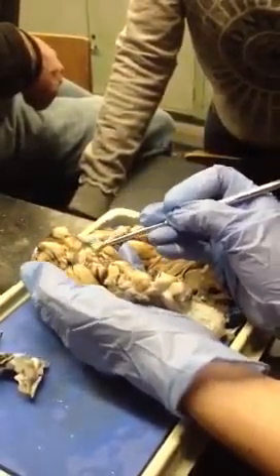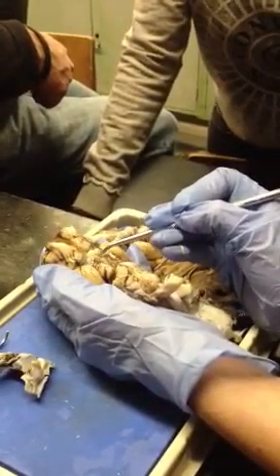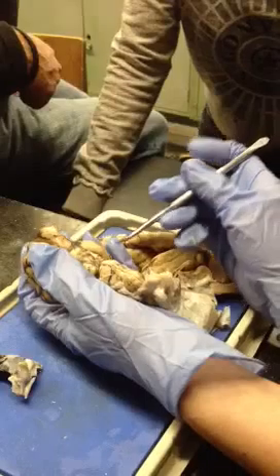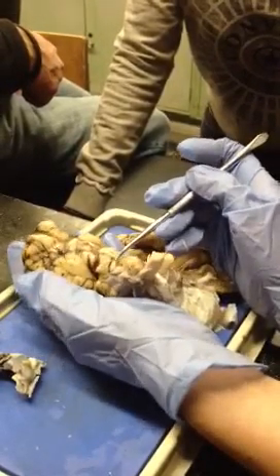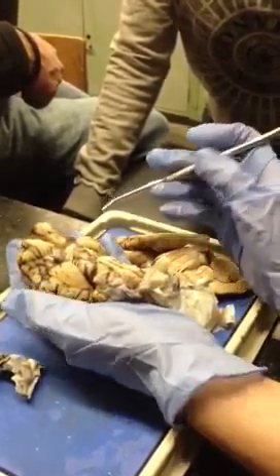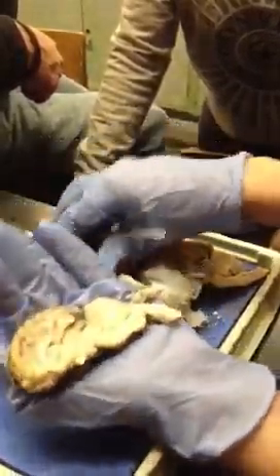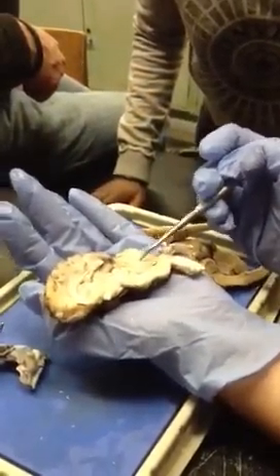Then here there's a circular mass. That's the mammillary body. Then this is one cerebral peduncle, and that's the other. Then here where it bulges a little bit, that's the pons. And then here's medulla, and here's spinal cord. So, you guys know cerebrum and cerebellum, right? This is all cerebrum, and this is the cerebellum with the arbor vitae.